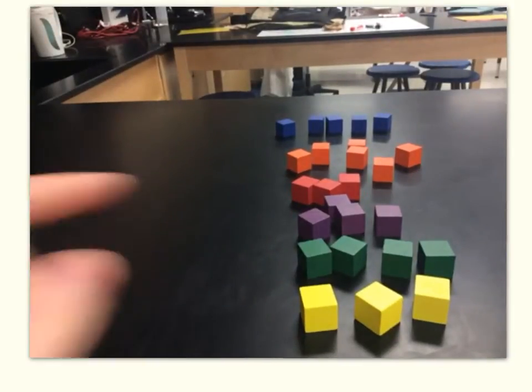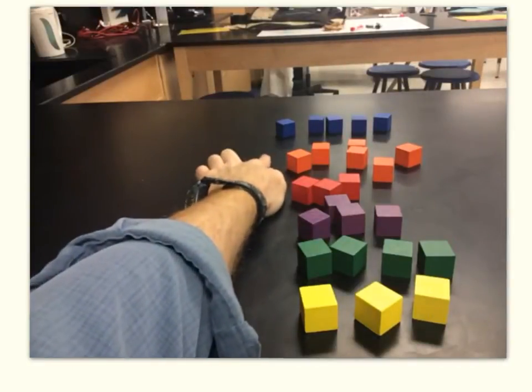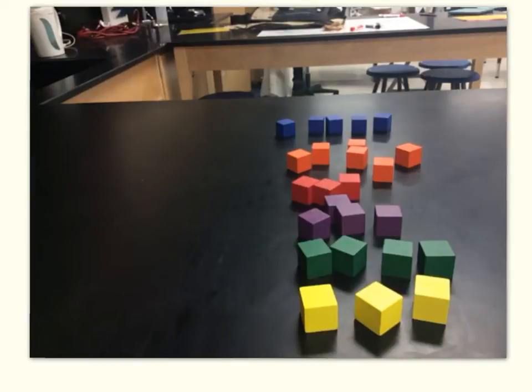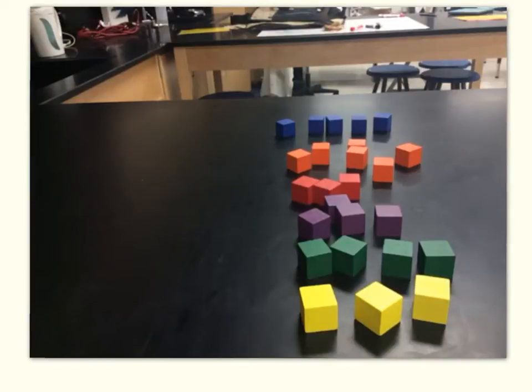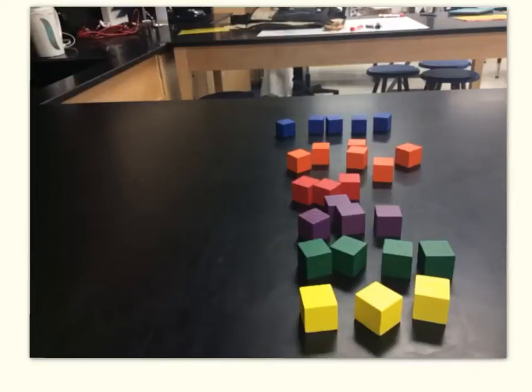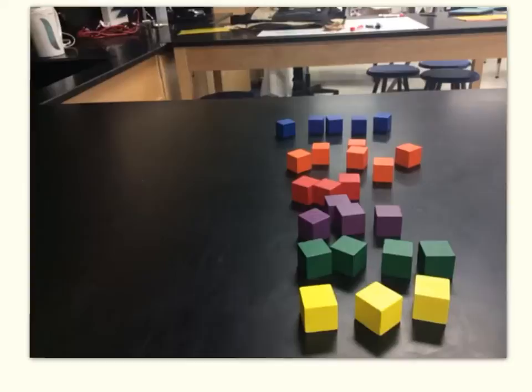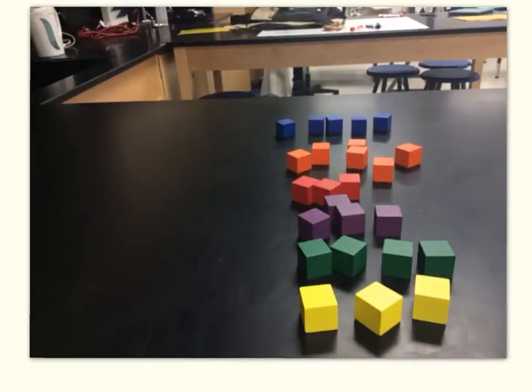Each substance moves at a slightly different speed through the chromatography, and because of that they start to separate themselves out. It might look like we've created a blue substance up here, but we haven't — it was already blue. All we did was separate that blue stuff from the jumble of all the other colors. Chromatography is not a chemical change; it's just a physical change. All we're doing is separating things based on their affinities to the mobile phase and stationary phase.